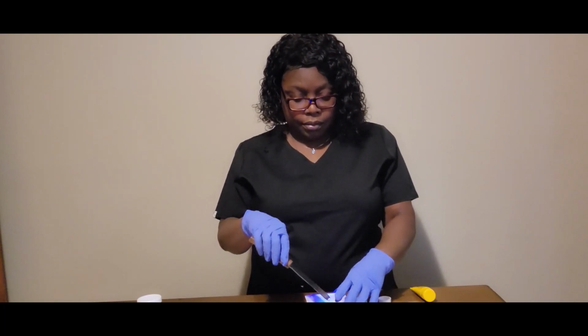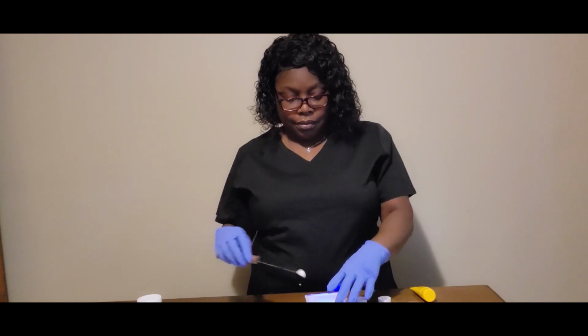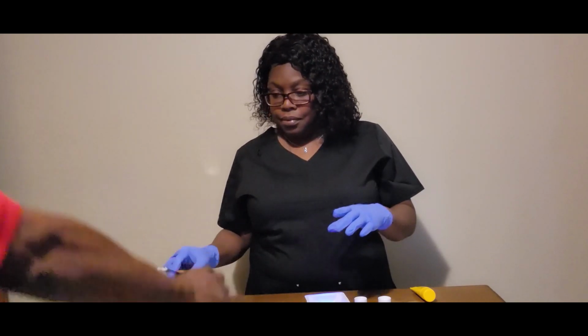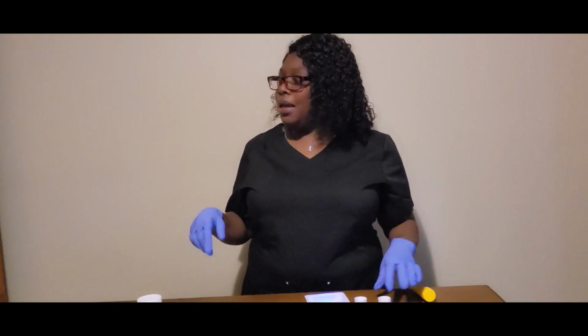Plus or minus 10%. I might need that when I mix it.